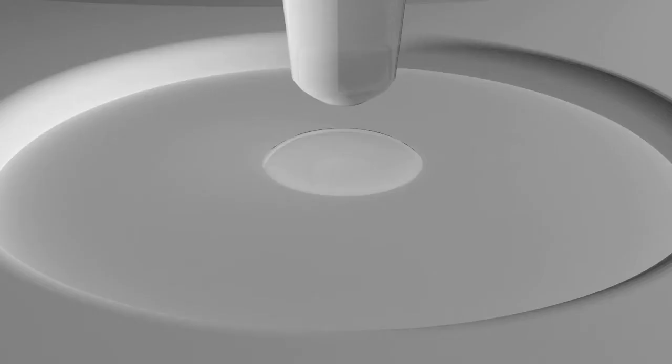To test, add a drop of ammonia test liquid. If you see any color change, even the palest shade of blue or purple, rinse again and then test again. When the ammonia test indicates no color change, it's time to give your mud a final rinse with distilled water.